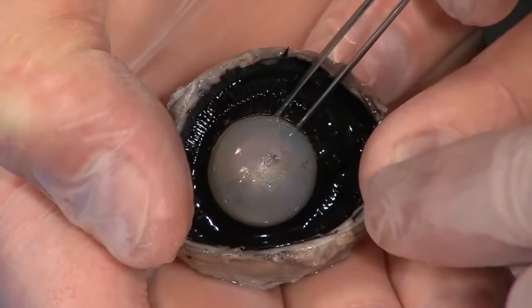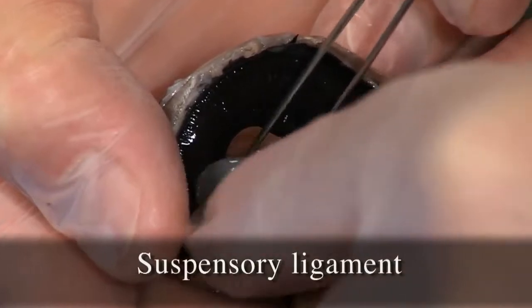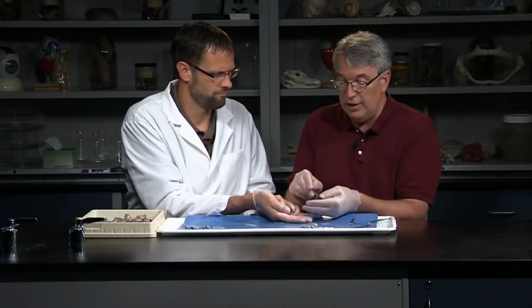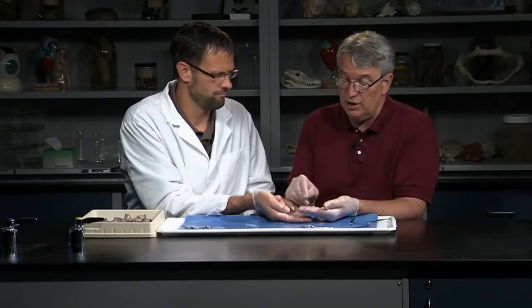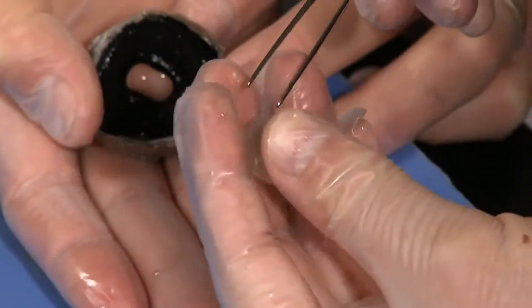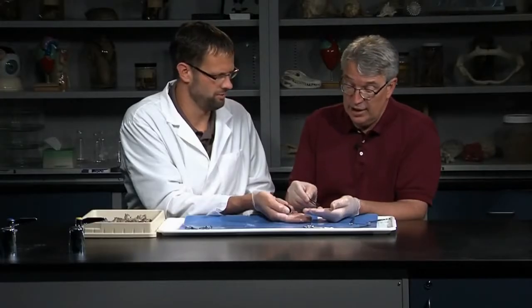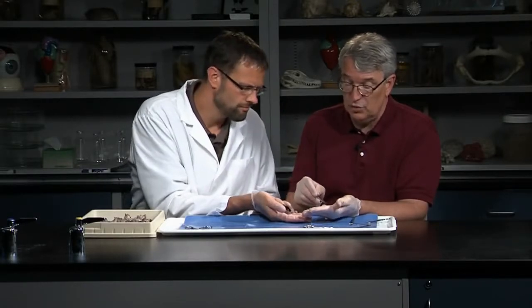At this point you can just pull that lens out. That lens kind of just pops right out of there. You'll notice it's very hard — more so in preservation than it would be in life. But you can see it would be transparent; light could pass through it. It's not a perfect sphere — it has a shape to refract the light and focus it right on the retina. The lens can become cloudy; you can lose the ability of the lens to focus light.